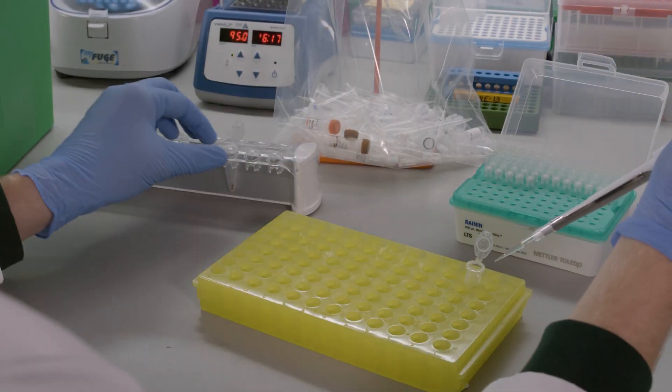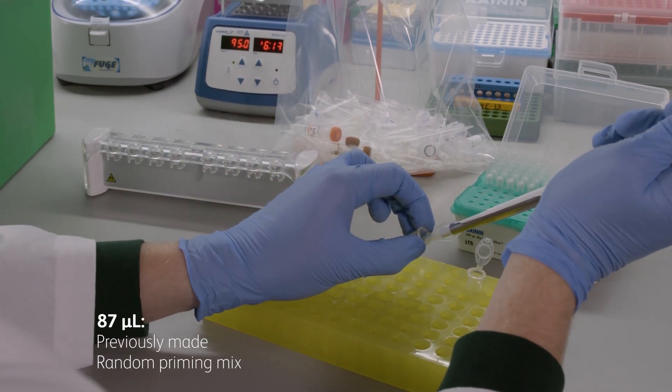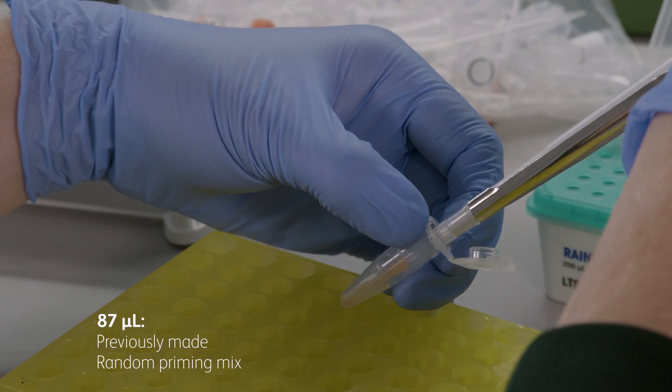Next, remove the tube from the magnet and resuspend the beads using 87 microliters of random primer mix that we previously made.